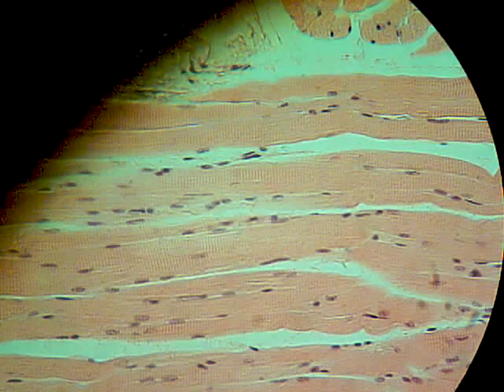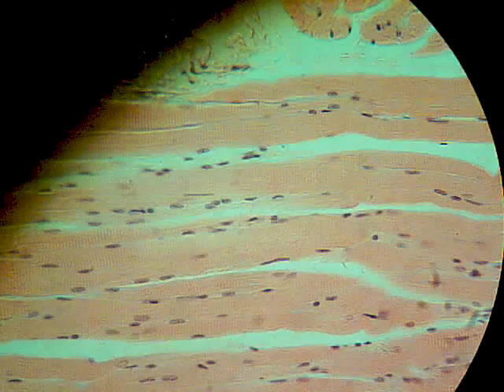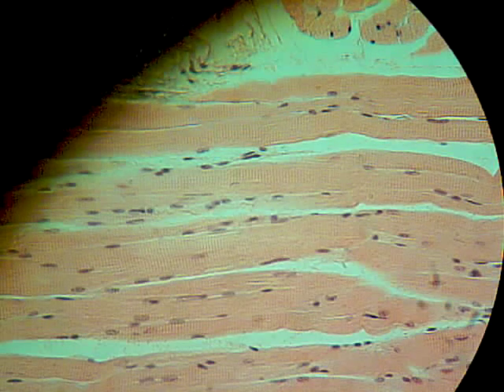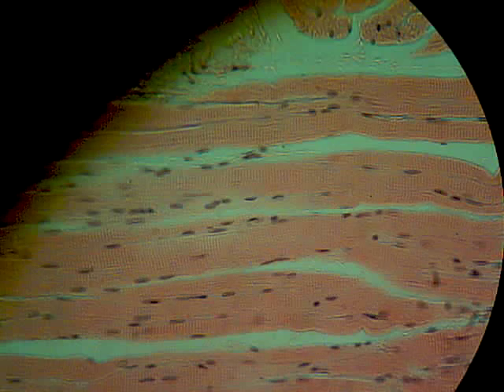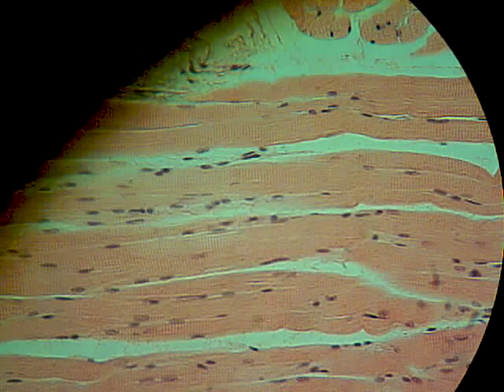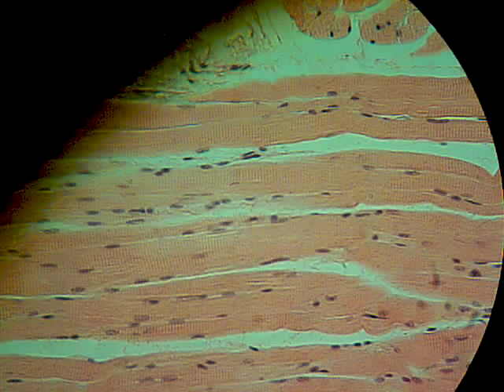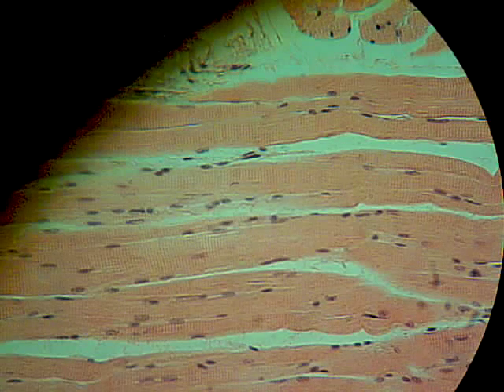It has those little vertical lines that are appearing and disappearing as I focus in and out. You have to look carefully, but you should be able to see them. I'm going to turn the light down a little bit so you can see them — they're there. Little tiny vertical lines. Focus in and out — those are the striations of the skeletal muscle. So a little tricky: find a particular section and then find the layer in which the muscle tissue is found.